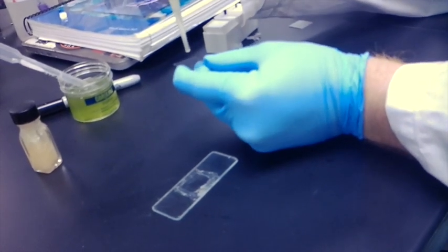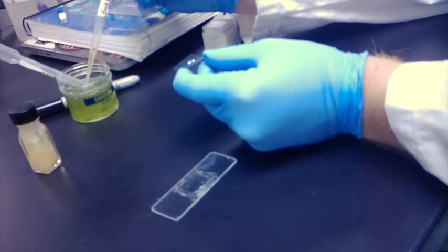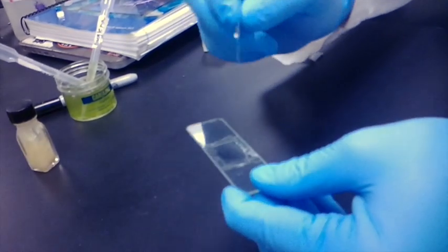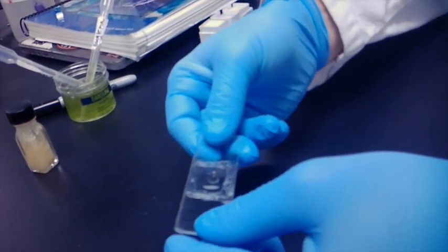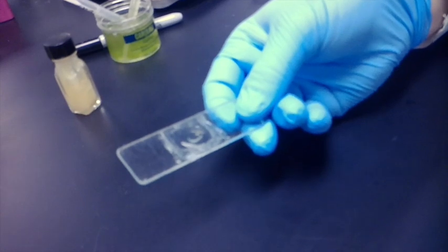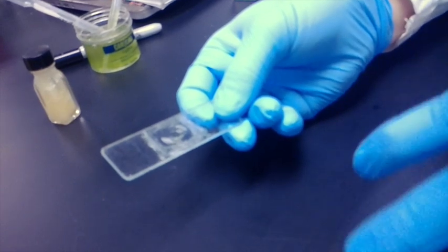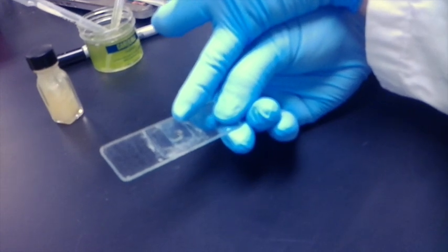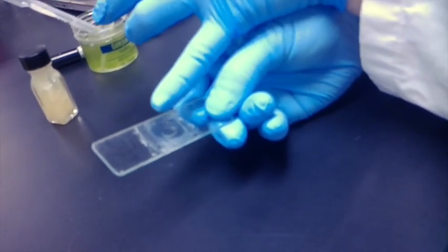We take a drop, then take this droplet and invert it and carefully place it onto your slide. As you can see, in the wet mount slide we had our solution spread out across the slide. In this hanging drop, it is basically localized to where you have that droplet that you applied onto your cover slip. And now this will allow us to visualize our euglena.